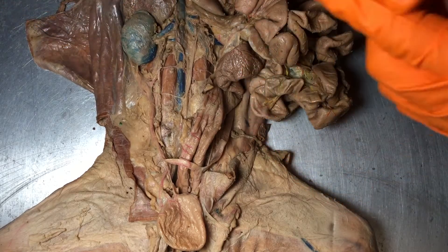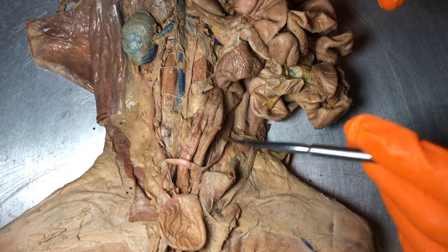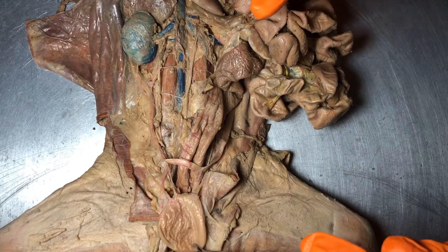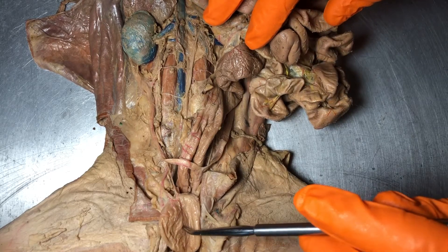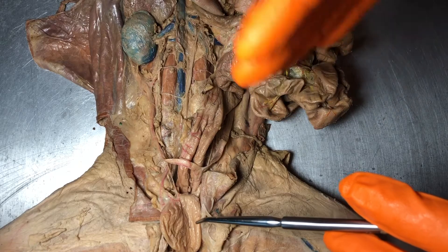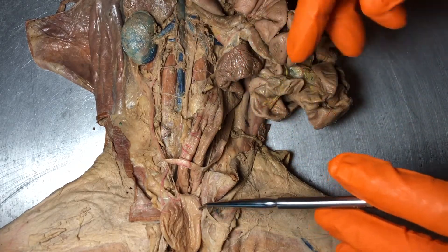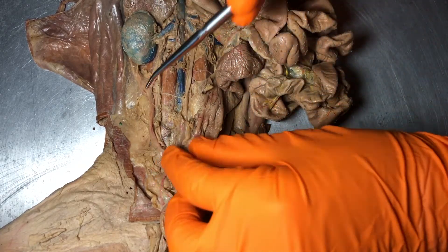The other major structure I want to point out before we return to those ureters is this urinary bladder. The urinary bladder is going to be the pouch that holds the urine before it's excreted through the urethra.